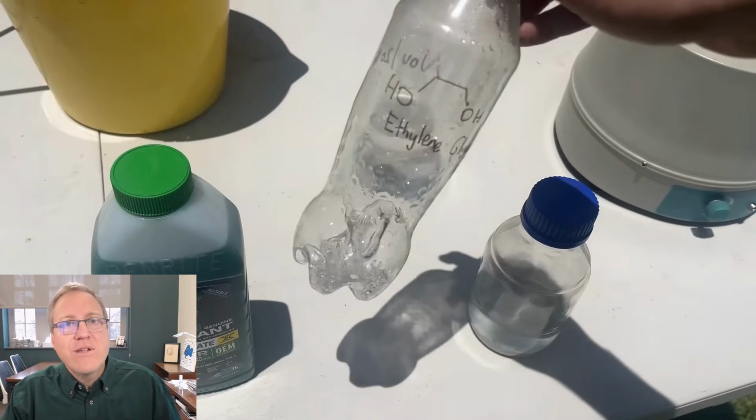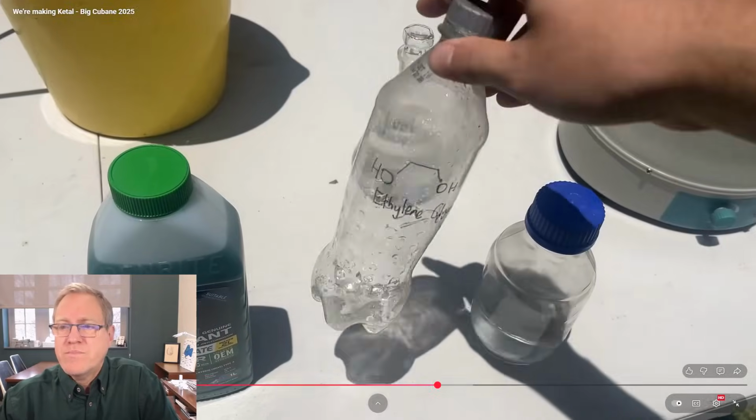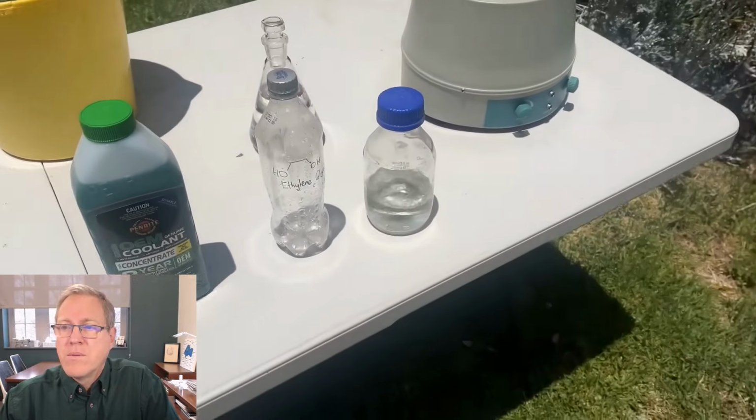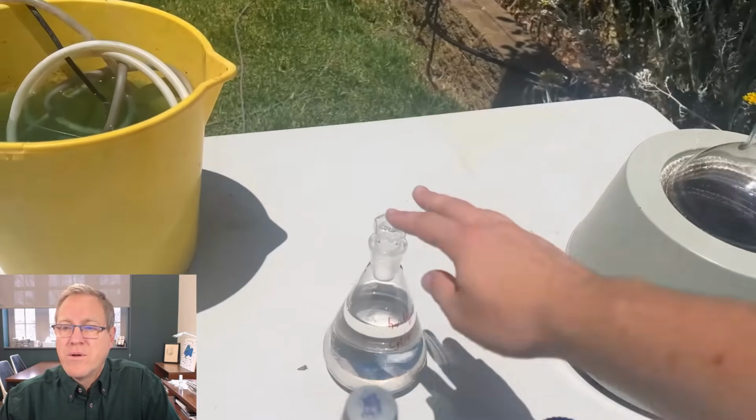And so when he distilled it, colored impurities tend to be very high boiling, so you can separate based on their boiling point. And he got his ethylene glycol, and he has some nice looking ethylene glycol to use in his reaction. A little bit in this little plastic bottle, but it's beautiful, dry stuff. So I'm sure there's enough there. Well, I don't know. Maybe that'll be our limiting reagent, but it should be enough to do quite a large scale reaction here. We've got our cyclopentanone.